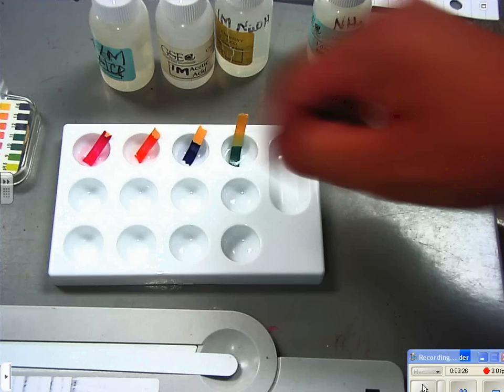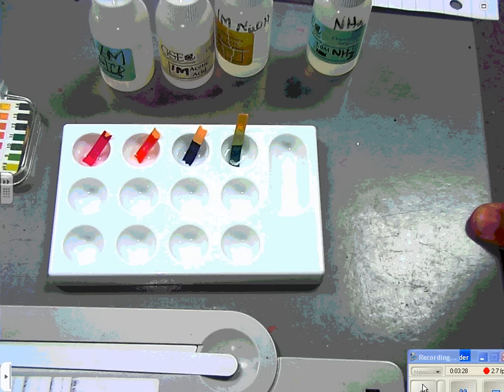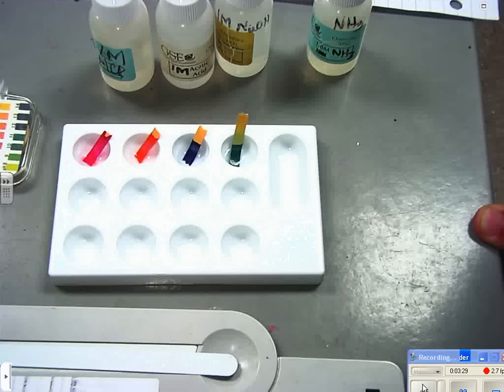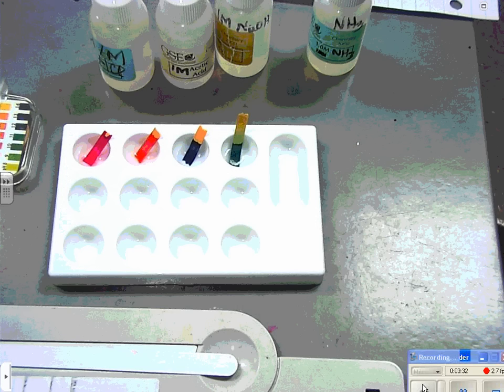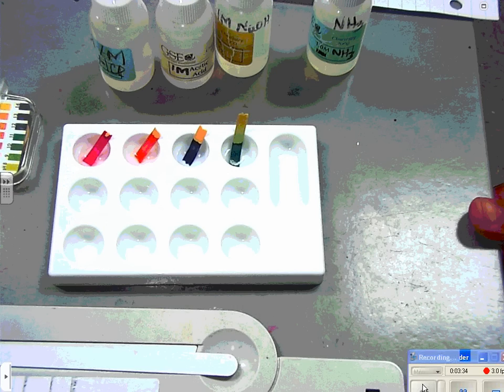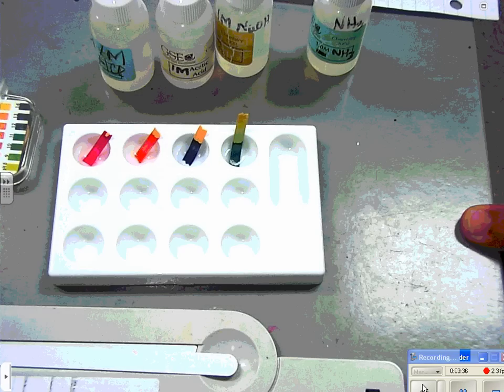Then you have to test the next one. What's the ammonia look like? 11.